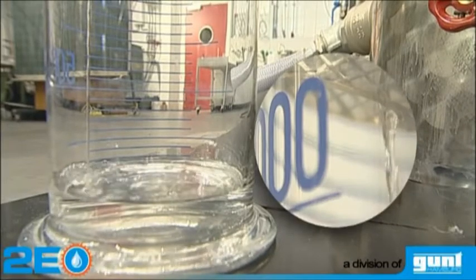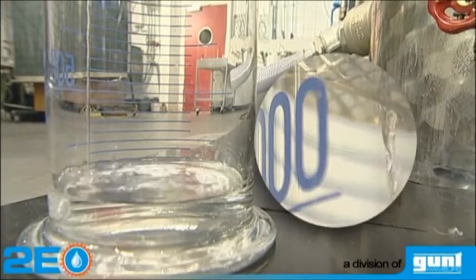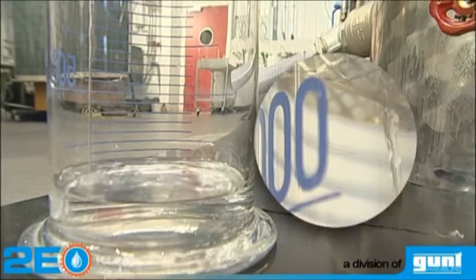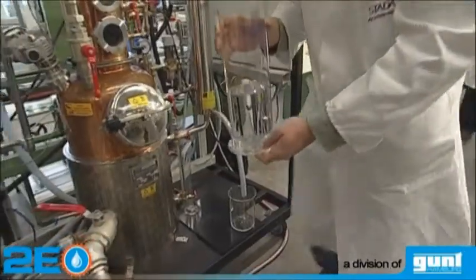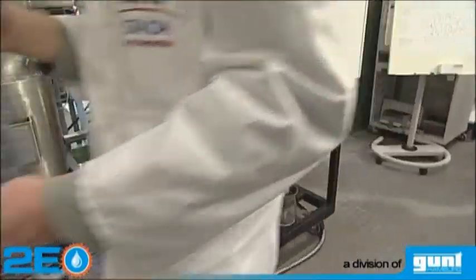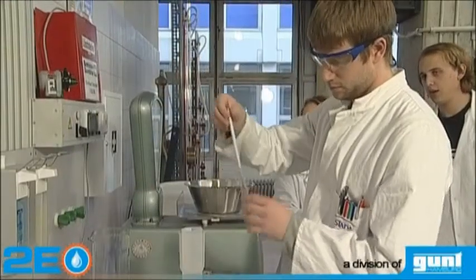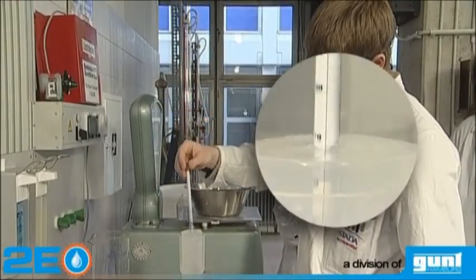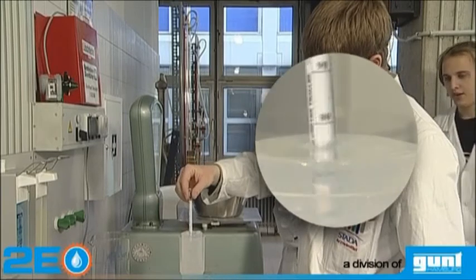The finished distillate is collected and a sample is removed for analysis. The ethanol concentration is measured to determine the total yield of the process.